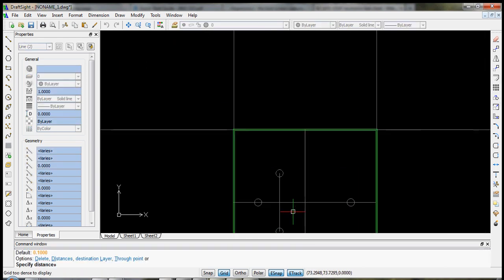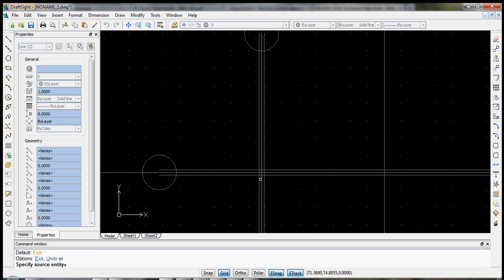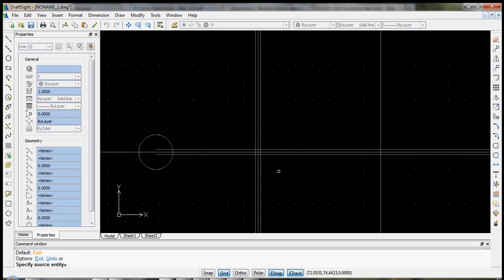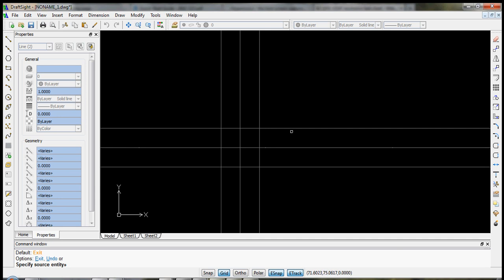Now our total dimension here, we'd like it to be 150 microns wide, so half of that is 0.075, and we'll select our 2 lines. Okay, you can see we've now offset by 150 microns. And now if we zoom into the center, we're going to get a little bit more creative here. We're going to round over these edges and make a narrow constriction in the middle that's only 50 microns wide.